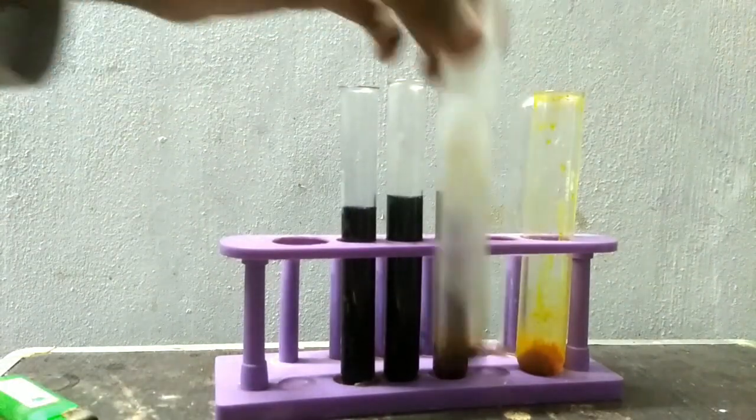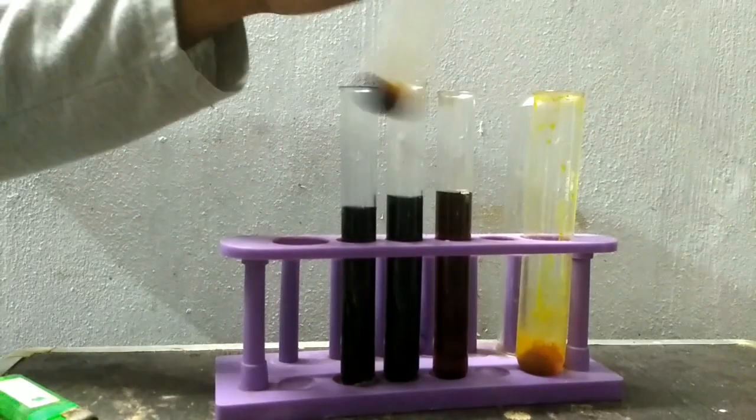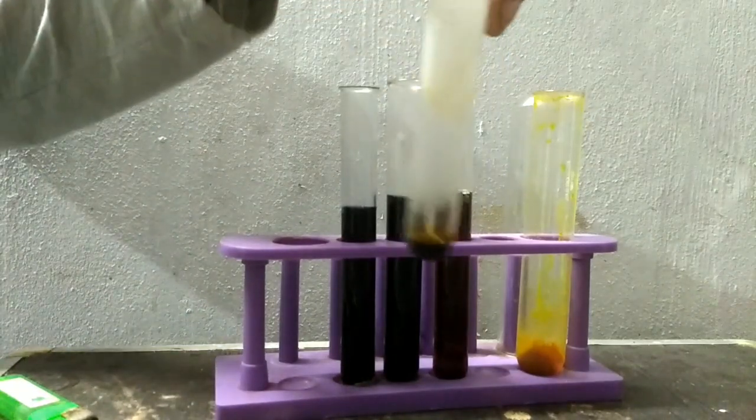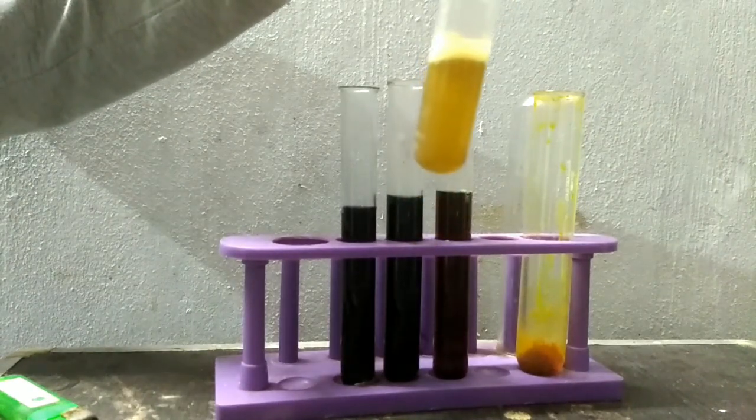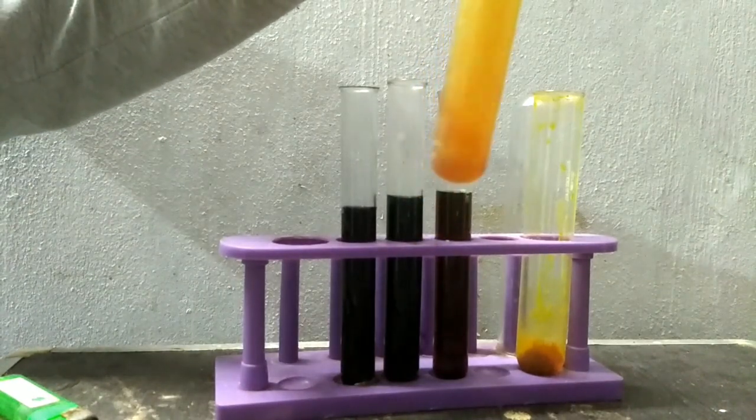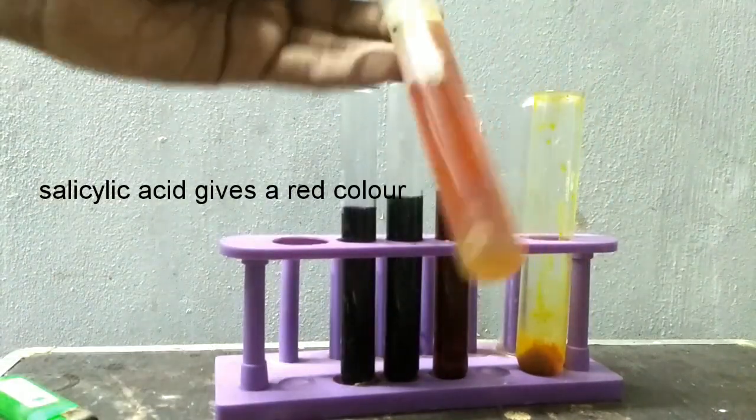Now to the salicylic acid one. And there you see.